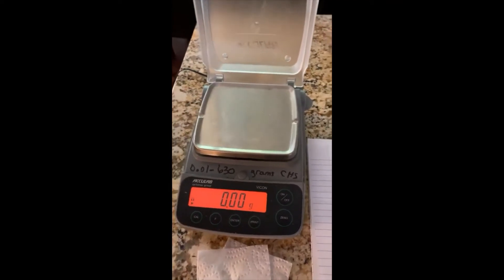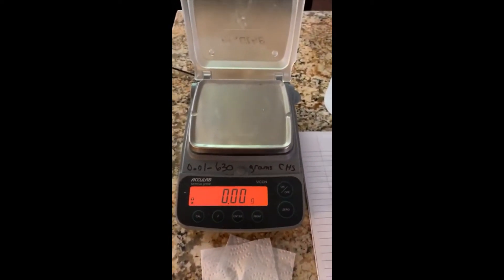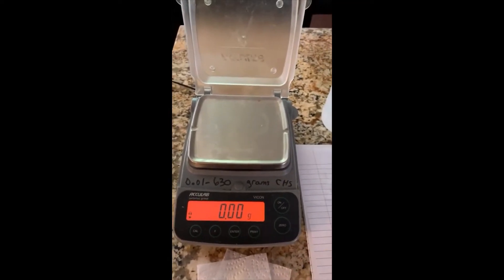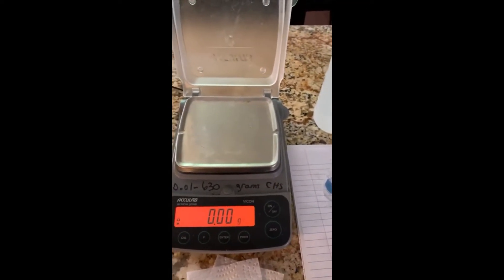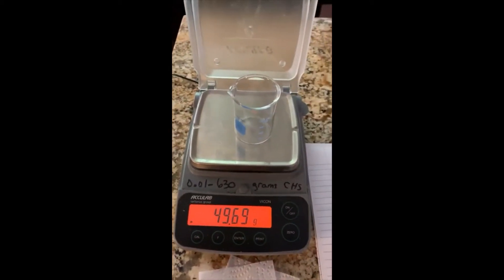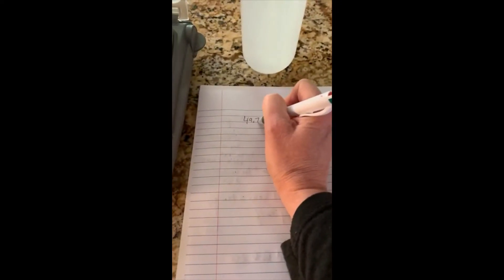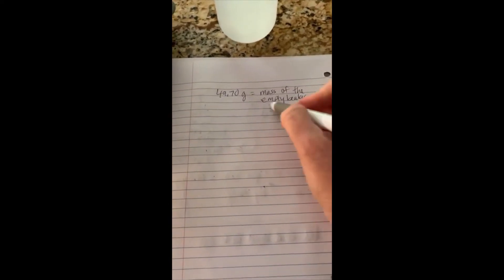Now, what happens if your tare button doesn't work, or you're using a scale that doesn't have a zero or tare button? How do I measure the mass of the liquid? For this situation, we're just going to measure the mass of the beaker and write that down. You always want to be detailed in your lab notebook: 49.70 grams is the mass of the empty beaker.